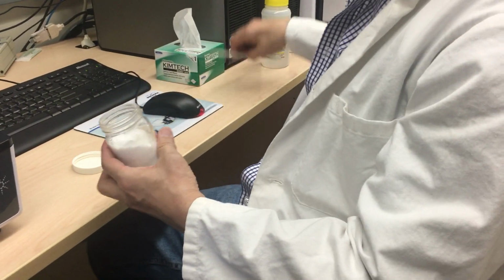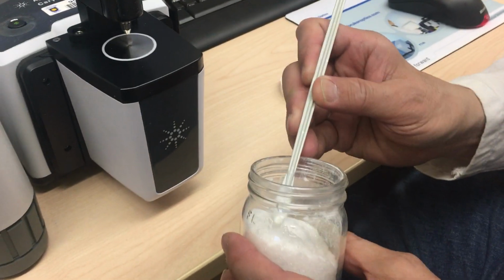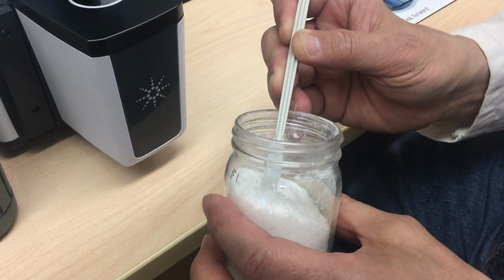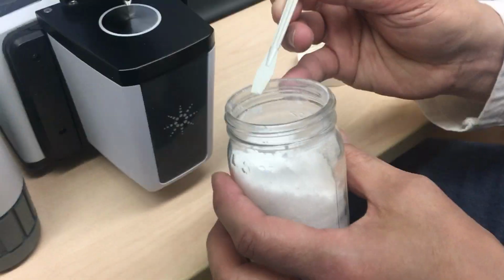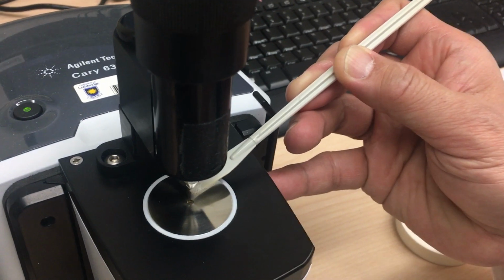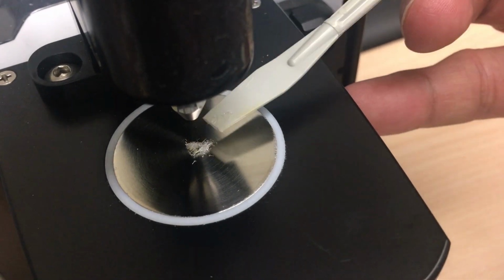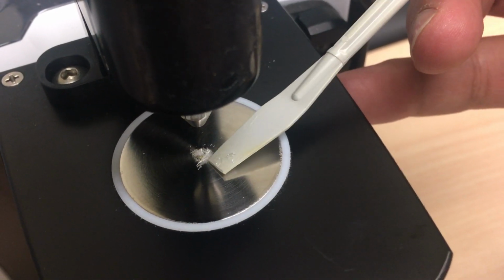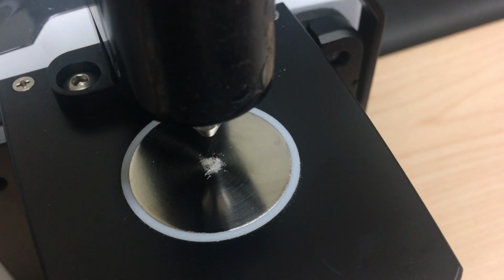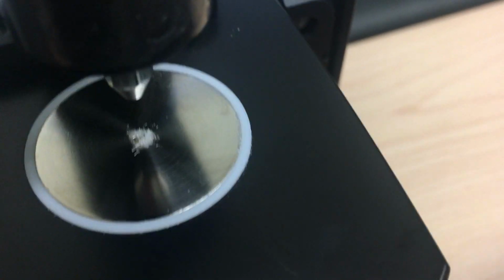So we're going to be running a small sample of your starting material, so we can save some time so you do not have to run the starting material. And it takes very little. All you need is just enough to cover this window right here, and no more. I probably have more than enough there. And gently, without scratching the crystal, place that right into the center, right above the hammer. And close your reagent bottle, and you're ready to proceed.